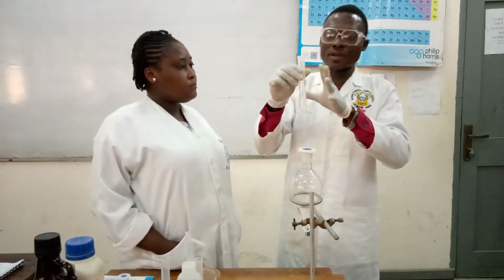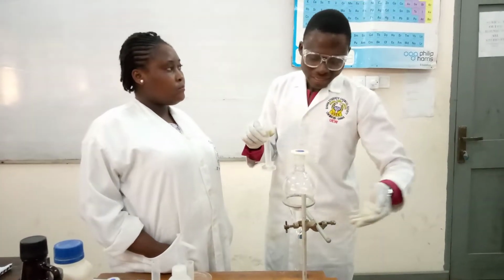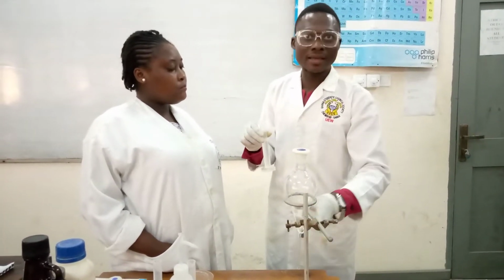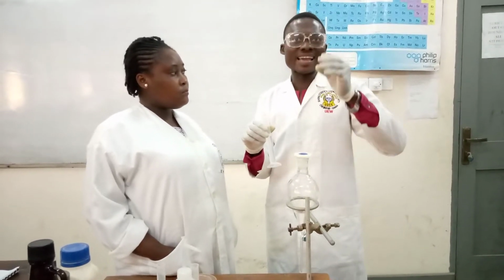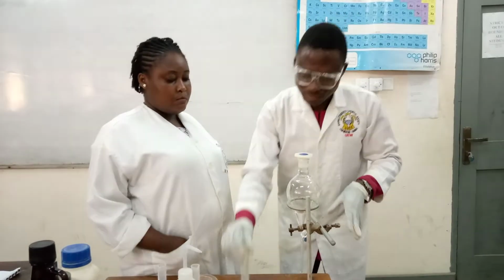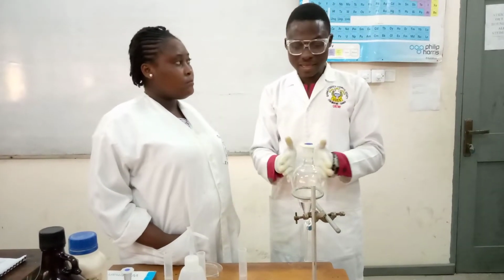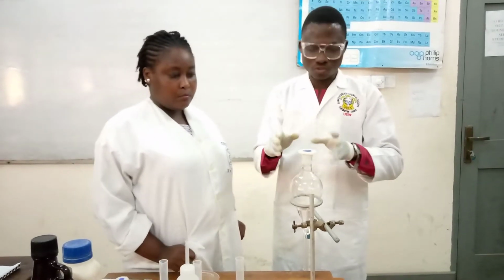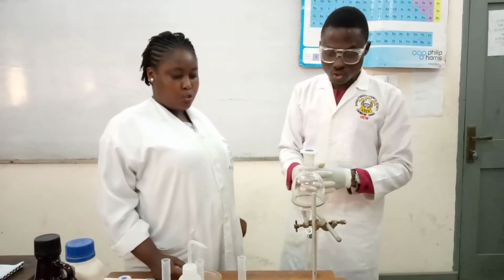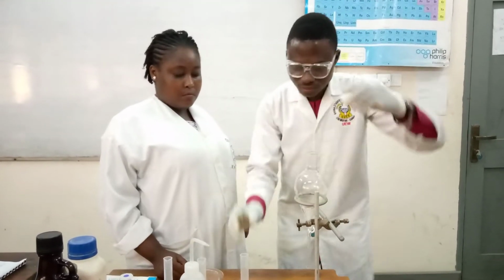So as the sodium hydroxide goes into the separating funnel, it goes to the bottom, and as it goes through the organic layer, it reacts with the benzoic acid. So what is the name of the salt form? The salt form here will be sodium benzoate. Okay, to form a salt. The salt form here will be what? Sodium benzoate. So that's the salt form. So if I'll just do that, I'll just transfer.